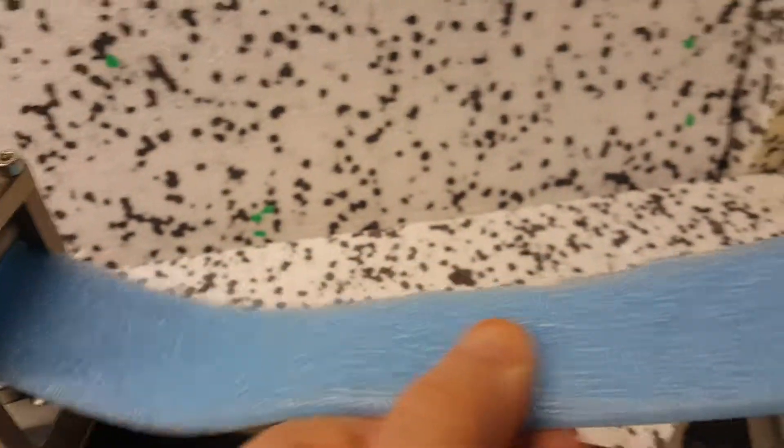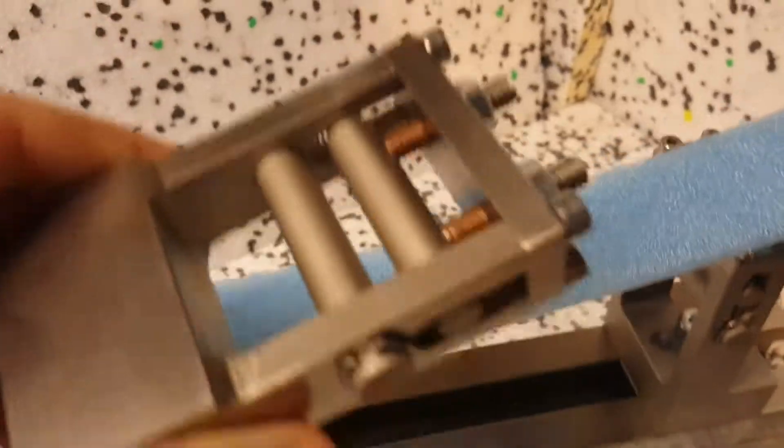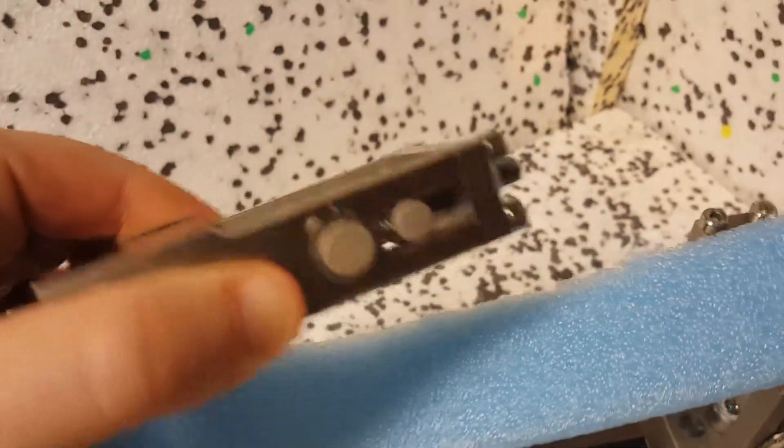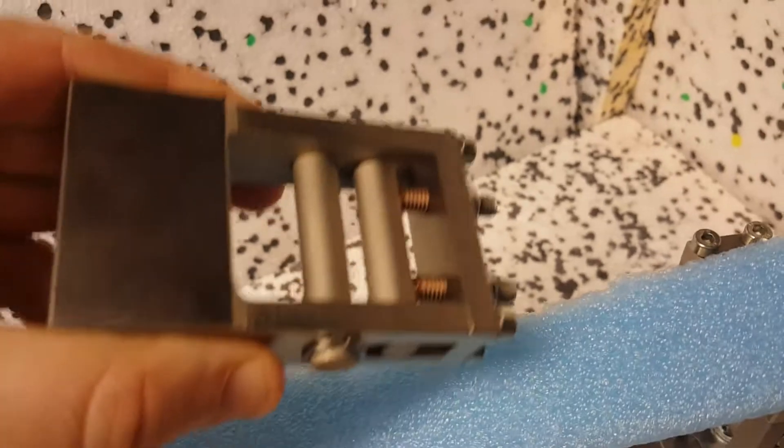You might insert a sample like this piece of plastic, which goes right in like this. And then you would want to thread it through the top piece here. Similar to the supports, you put it right in the center and tighten it down.